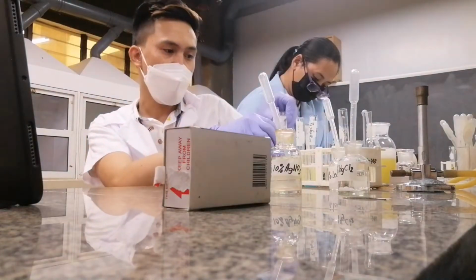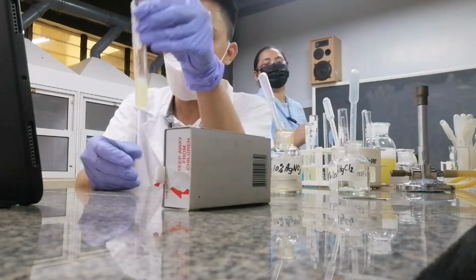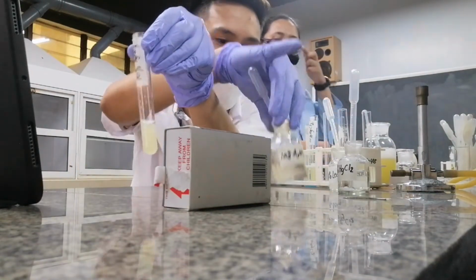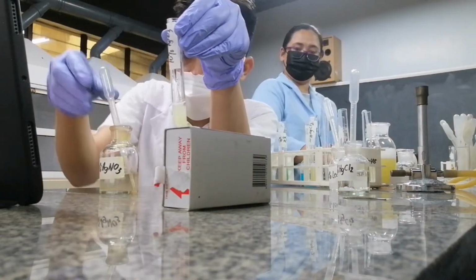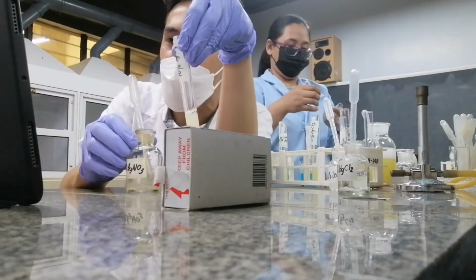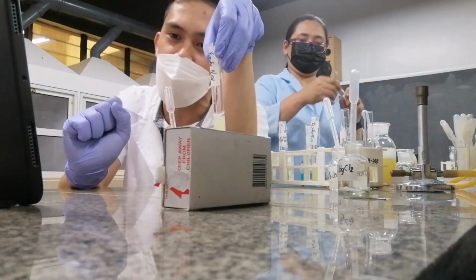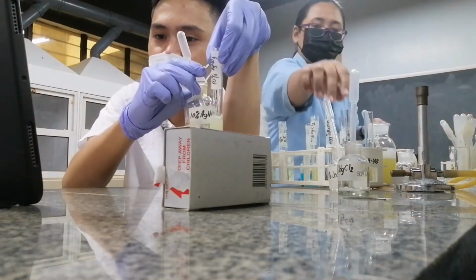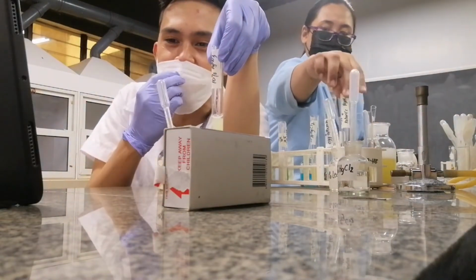Very good. So let's now try your silver nitrate. This one contains a label silver nitrate. So we'll add now your silver nitrate solution. Let's see what is the effect as well. So what do you predict is the effect? Is this precipitation or coagulation? Okay, this will be precipitation.